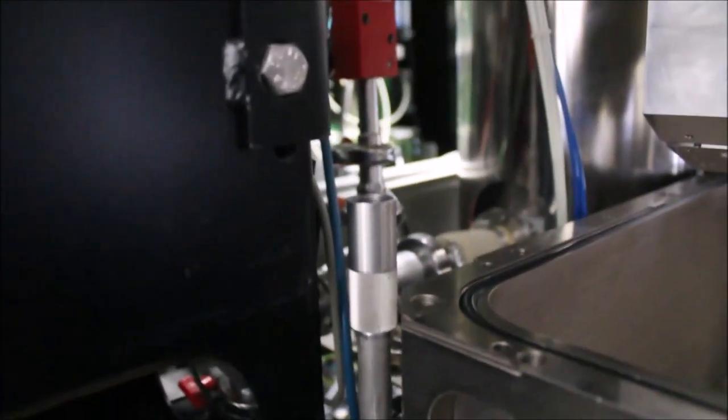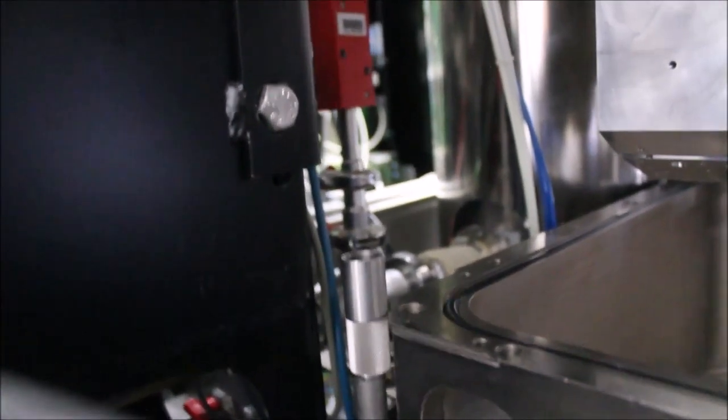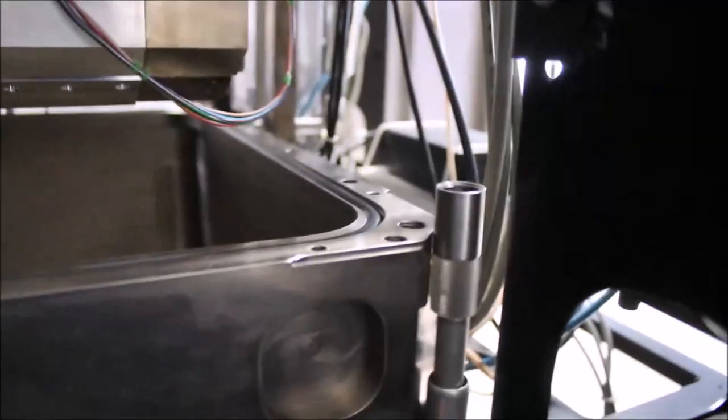As I turn the crank, they get lower and lower. We want to have them come down to where they're flush at the top of the sump. Kind of like watching grass grow. And so there we go. Now we're going to wheel this sump out of here. I'm not going to be holding the camera while I do that. I'll just show you when I get it out.